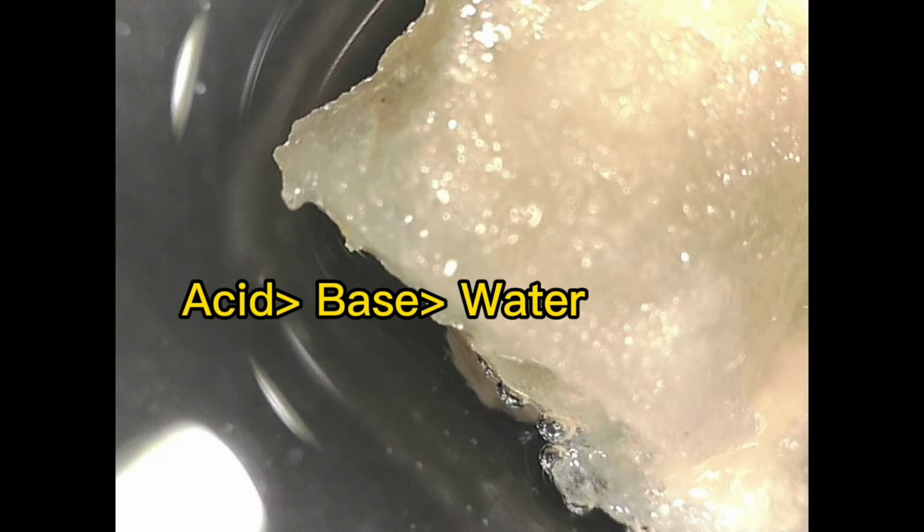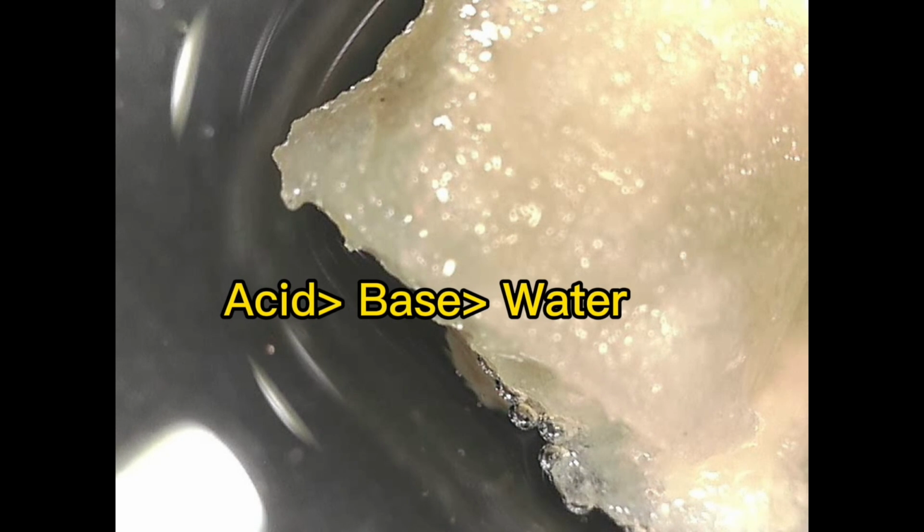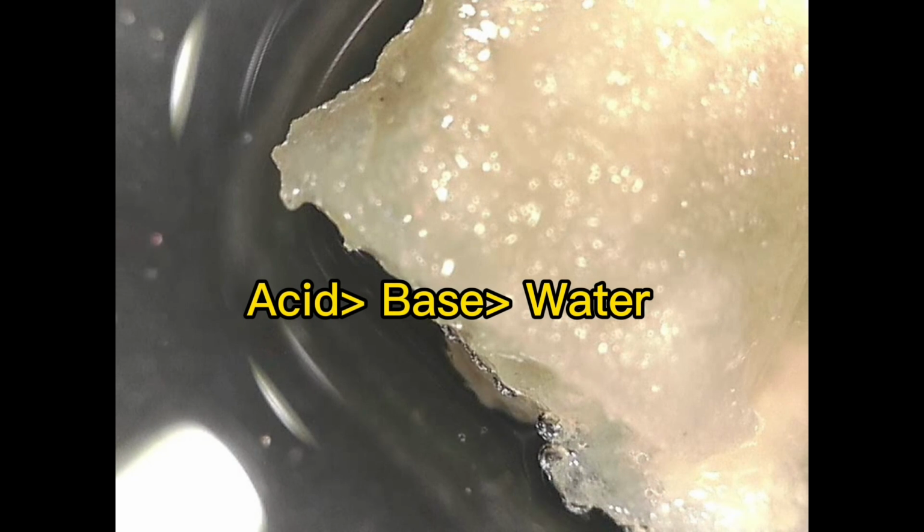According to the current observation results, the cleaning rate of French fries in solution is that the acid solution is greater than the base solution, which is greater than water.